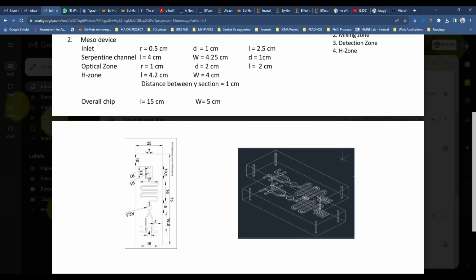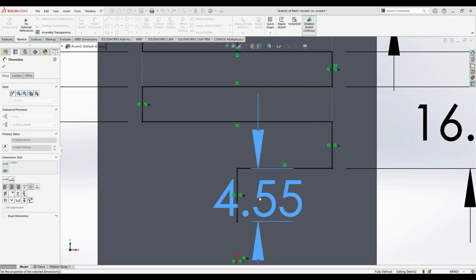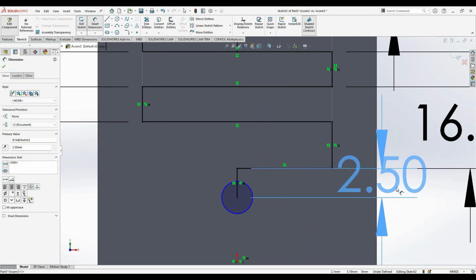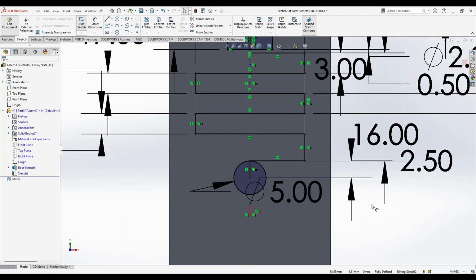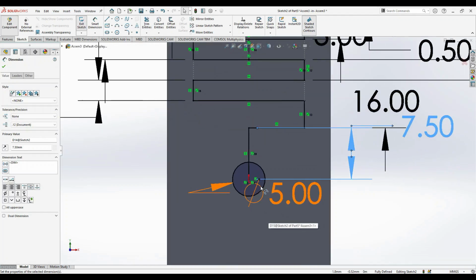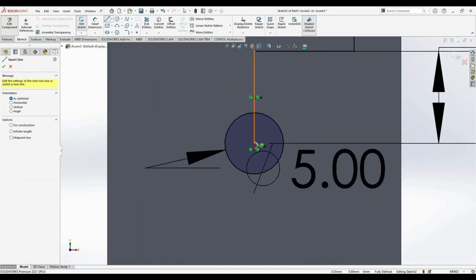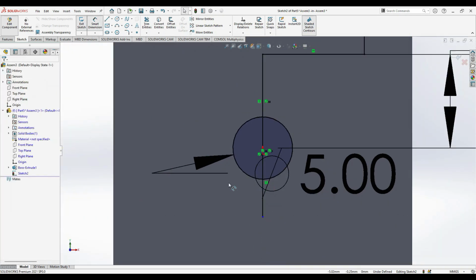So we'll choose a random. So we can create a 2.5 and then we'll create a circle of a radius. It's given as 2.5, so diameter 5. Right, so this will increase to 7.5. And further, the next line you can start to give as the next 7.5.